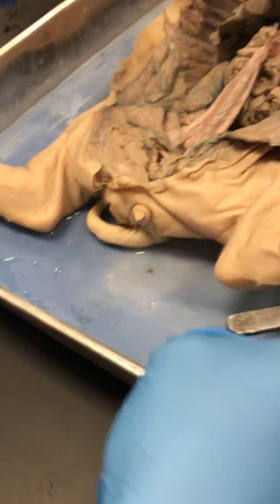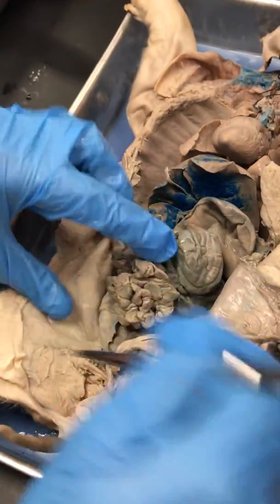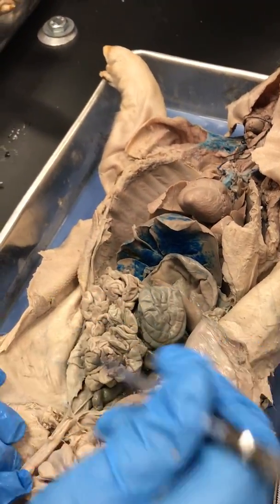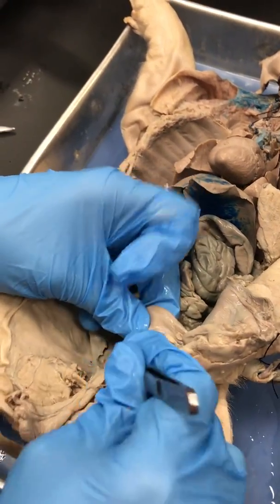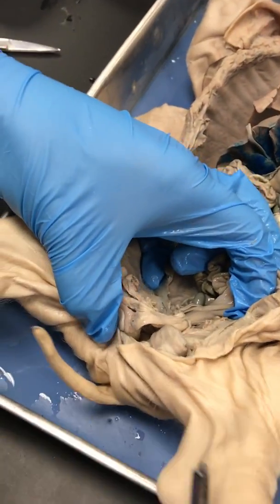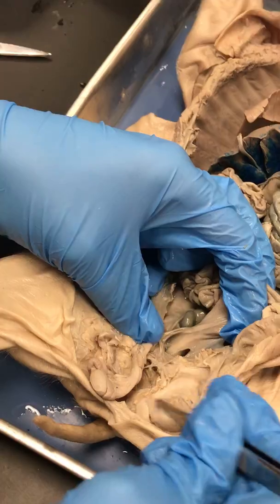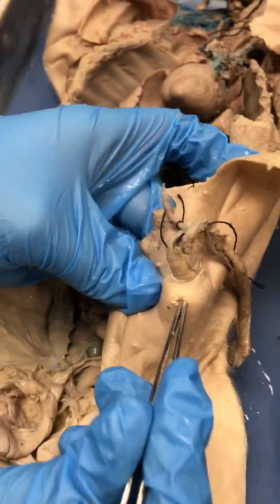Moving over, we're going to switch genders on our pigs here. We're going to move over to our male pig. All the rest of the urinary tract is going to be very similar in the male pig. Your big difference is going to be the way your urethra exits. Instead of your urethra exiting out a vulva, you don't have a vulva because it's a male, your urethra is going to come out and go around and actually exit out of the penis.